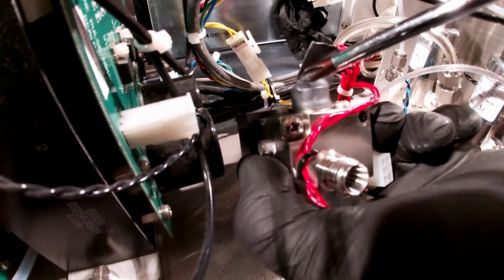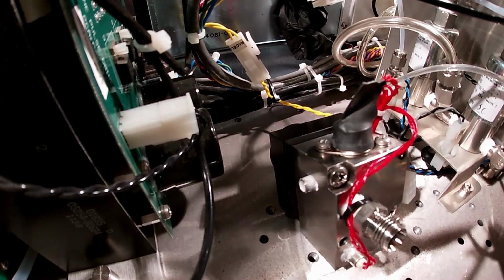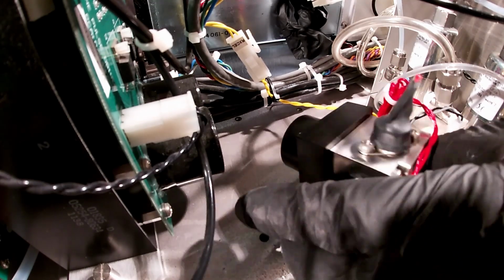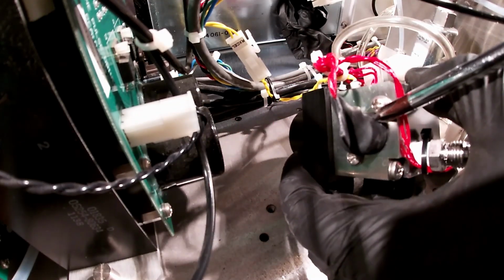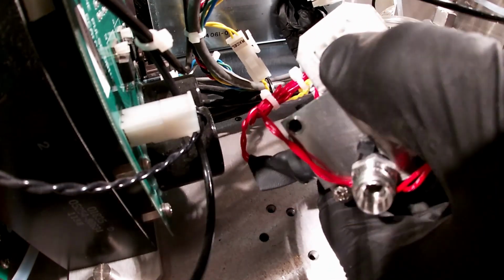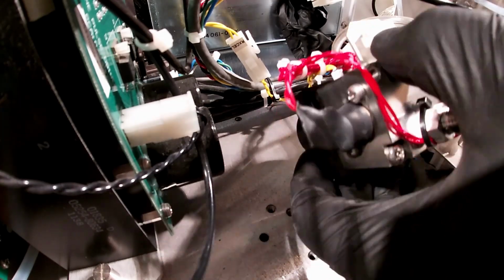While we're looking at it, you'll see this is our safety heater. So it's just a snap action thermostat. So anyway, this is just a snap action safety thermostat here. We heat it with this little rod heater here that's pressed through. It's got a heat sink paste on it. And then we measure with this temperature sensor here, and this is just going to cut power if for some reason the system runs away and tries to apply full power with no control to that rod heater. That'll be our safety. Actually, sorry, there's a heater here and a heater here, and the temperature sensor has the yellow leads coming out there.